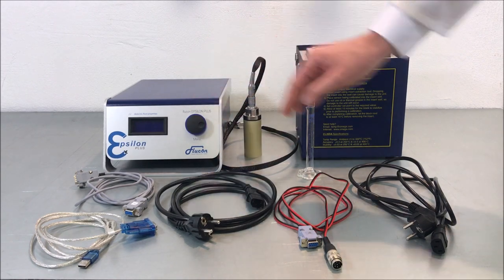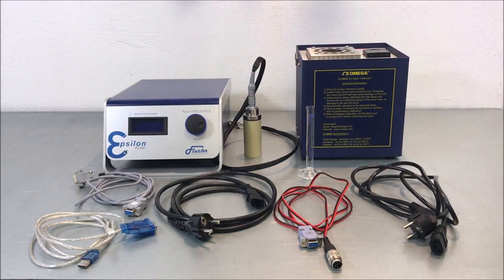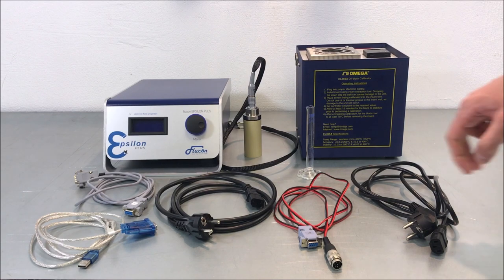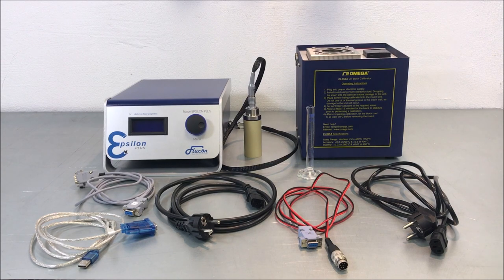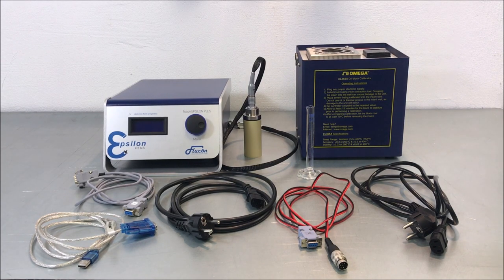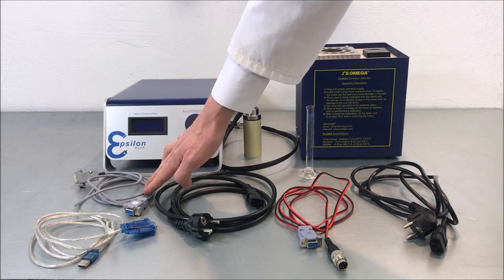Of course, there are mains cables for the power supply of both of these devices. The red and black cable can be used for connecting the Epsilon Plus to the thermostat.